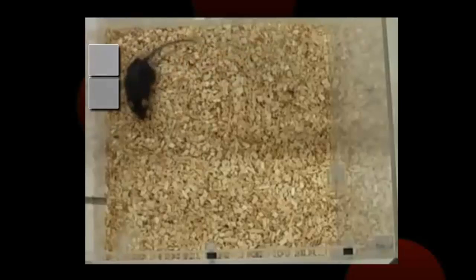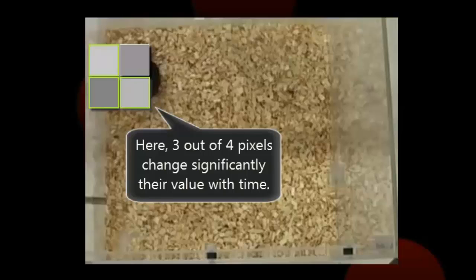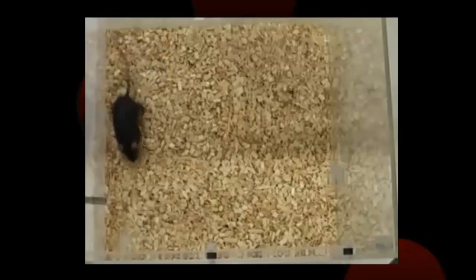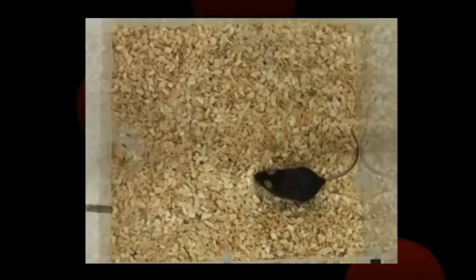Activity analysis is based on the number of pixels in the arena that change with time. Here, change means the change in the grayscale value, which ranges from 0 for black to 255 for white. Assuming that the animal is the only moving object in the video image, a high proportion of pixels that change in their value means that the animal is active. Conversely, a very low rate of pixel change means that the animal is inactive.